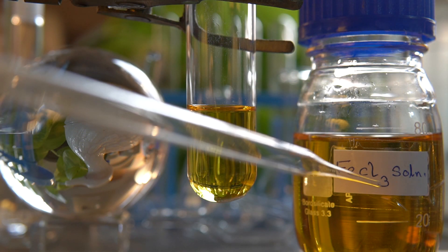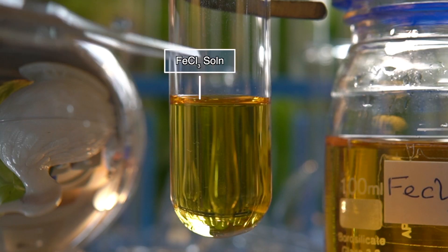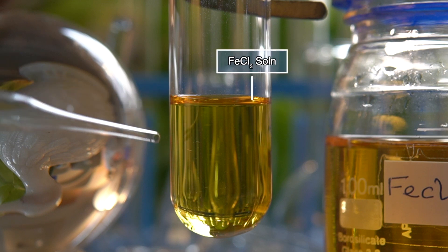Now to initiate the chemical reaction, we will take some amount of iron 3 chloride into this test tube.